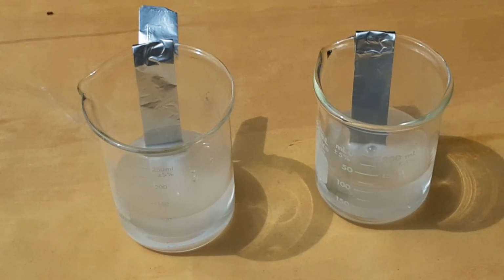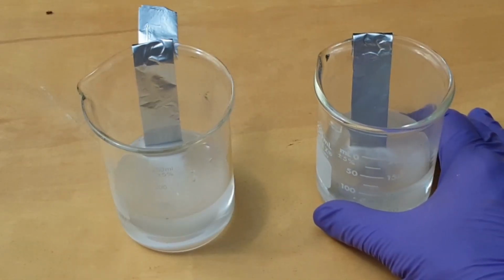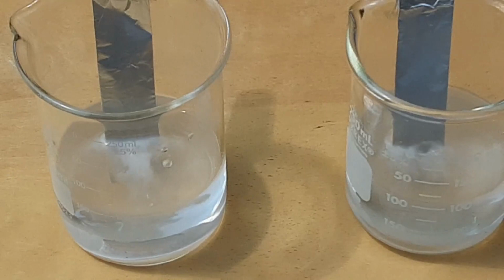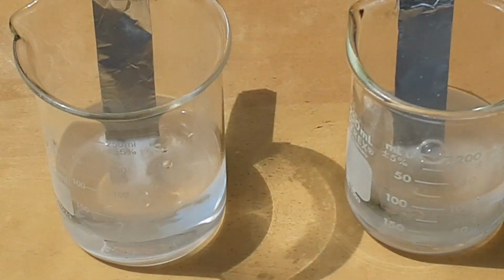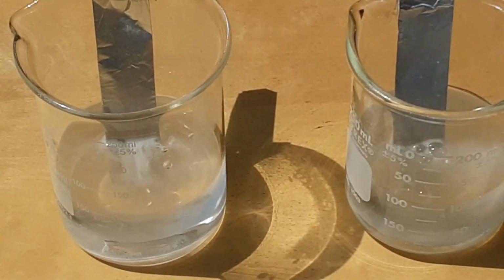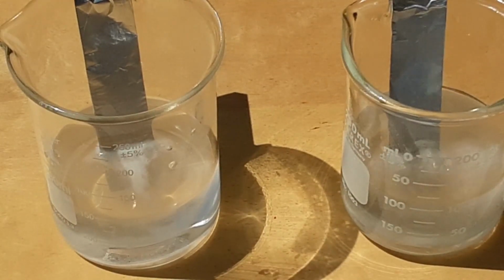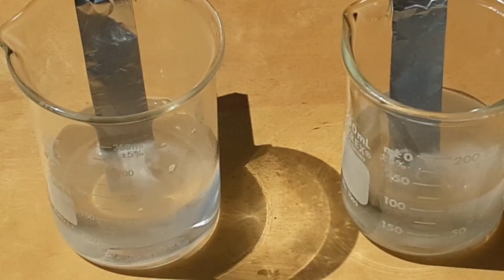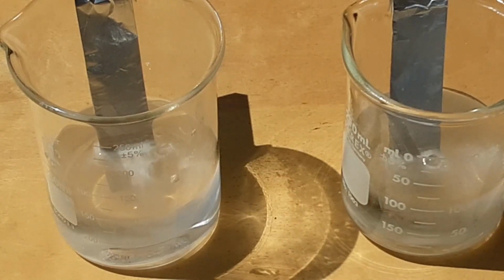I would say that the sodium hydroxide is slightly more reactive, but I'm not sure. The weird part is the bubbling in the potassium hydroxide, I'm just not sure. That's kind of complicating my decision of what is more reactive. I've seen this done before, and the potassium hydroxide in the videos that I saw seemed like it was less reactive than the sodium hydroxide, but I don't really see that case here.